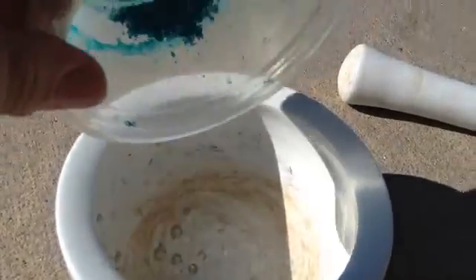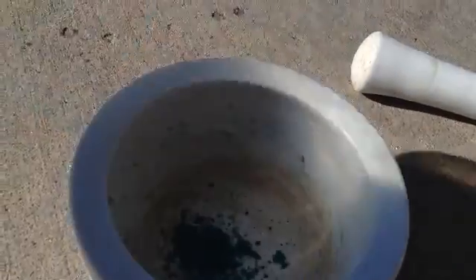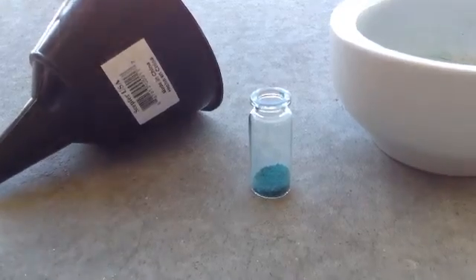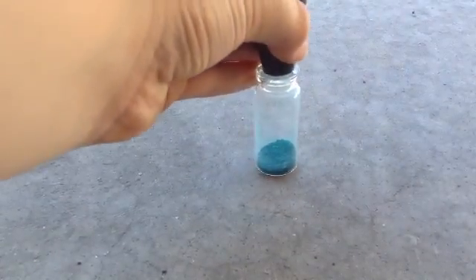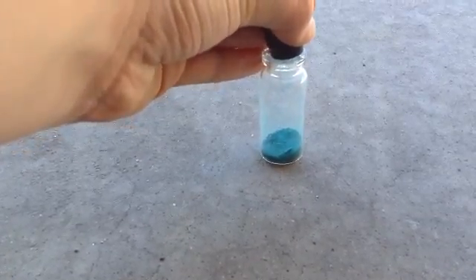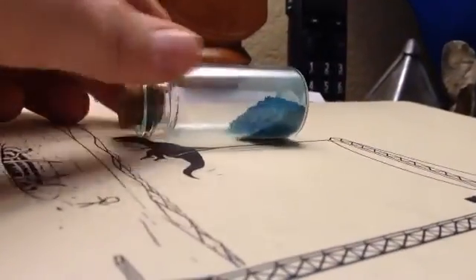I'm just going to scrape off all this stuff that formed on the side. I then transported all of the material into a mortar and crushed it with a pestle, then transferred it into a vial. And there you have it — you just made copper 2 acetate.